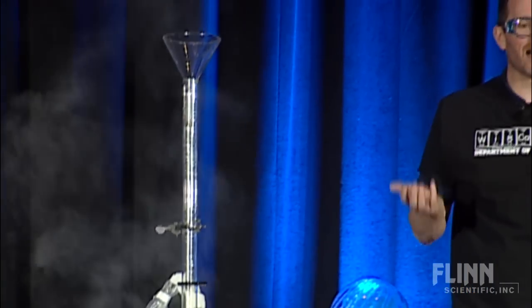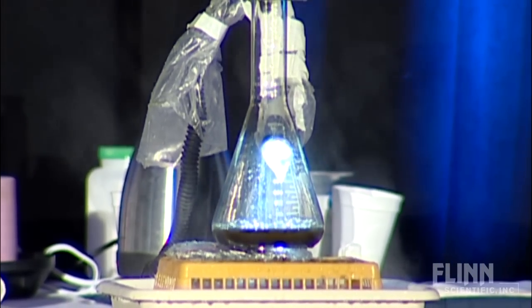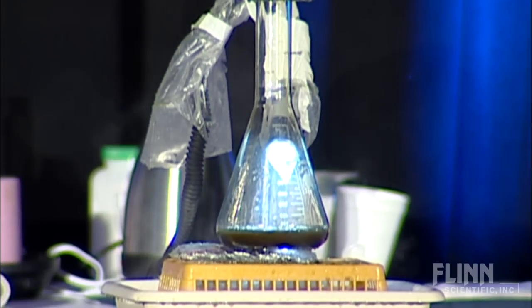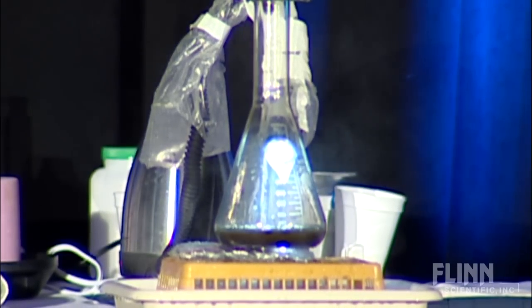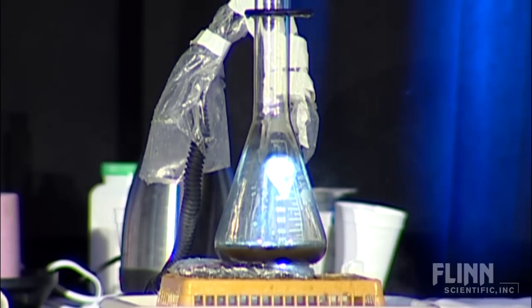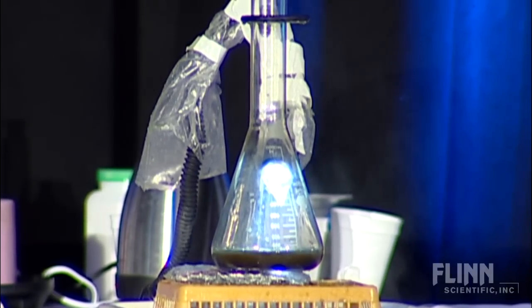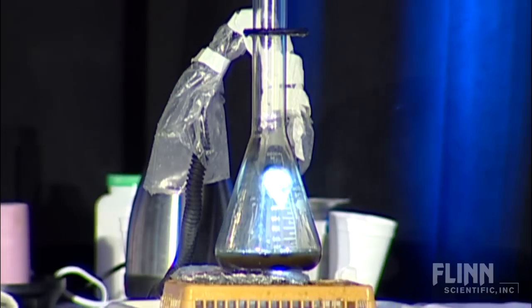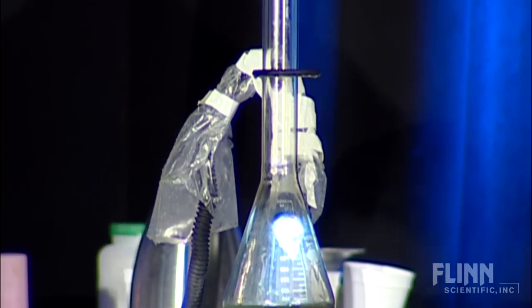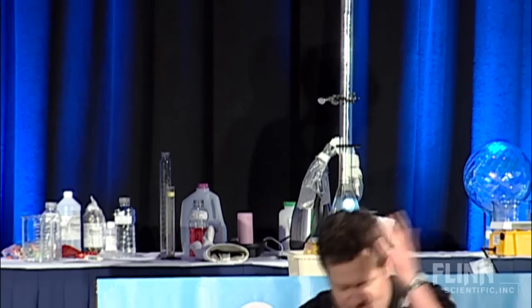When we're done, if we really teach the kids, the catalyst should come back. If you zoom in carefully, you should see that catalyst come back. I like the slow pace that it occurs because it allows that to process in the kids' heads, and they're saying, I don't see pink, Mr. Grosser. Show me that pink again. And if we wait and wait... The pink color comes back at the end. Normally, if you just follow the directions out of the book — there you go, perfect. So if his bubbles work now, maybe later on mine will turn back pink. There you go — pink catalyst.